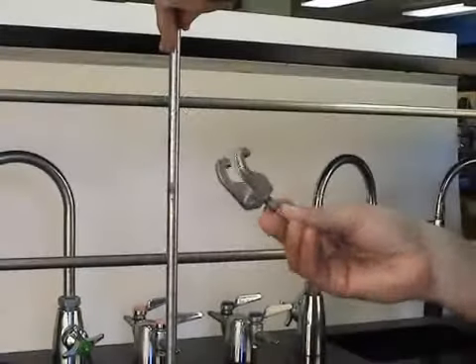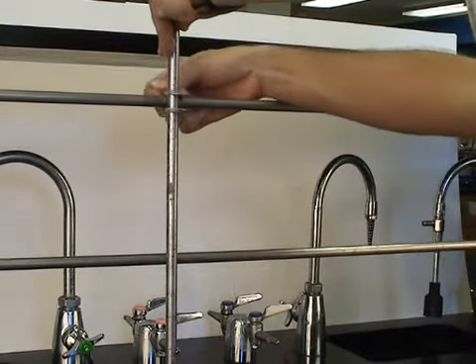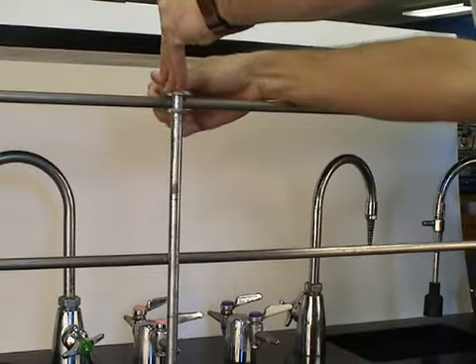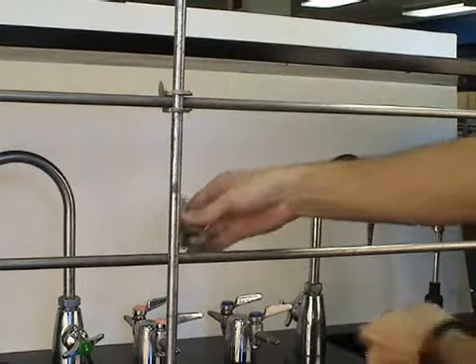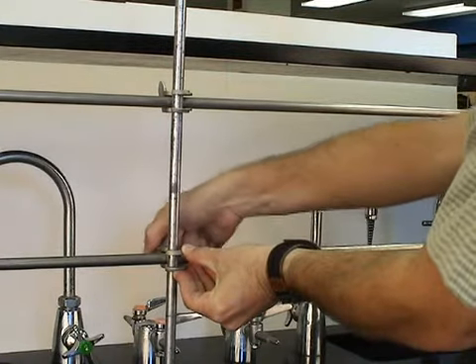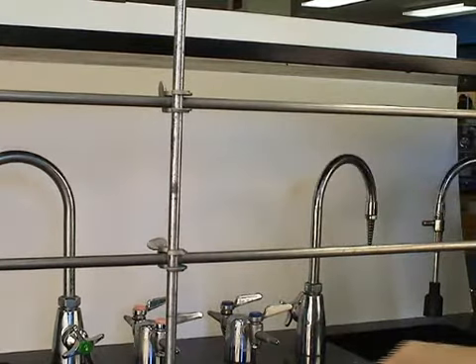Begin assembling a simple distillation apparatus by mounting an aluminum rod at your bench using two hook clamps. Put the hook clamps on with the thumb screws pointing away from you so they're out of the way of the other clamps you'll need for the apparatus and the apparatus itself. Make sure they're firmly mounted because this is going to be the base of your distillation apparatus.